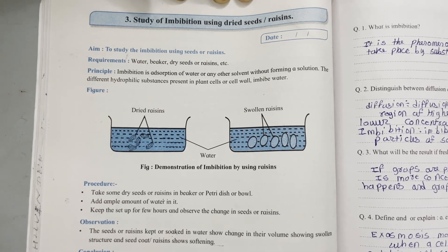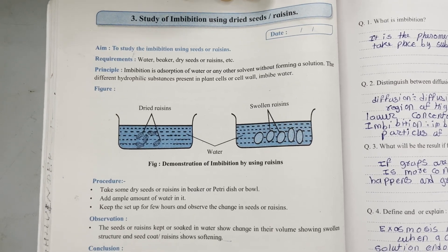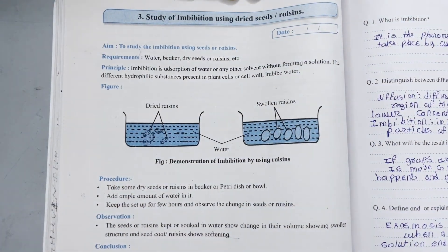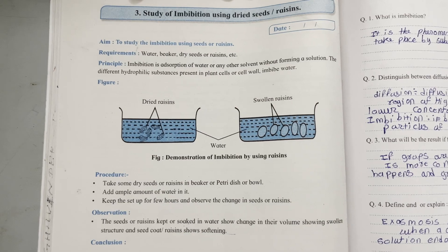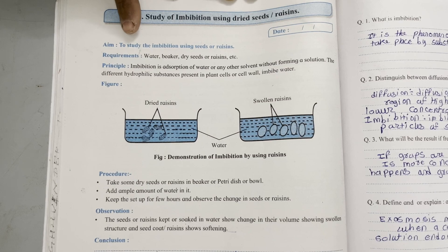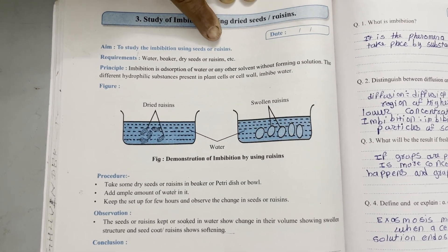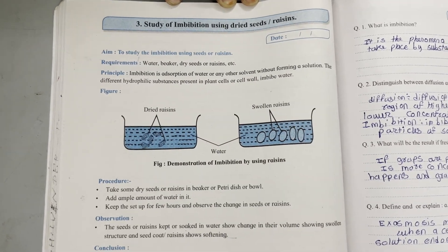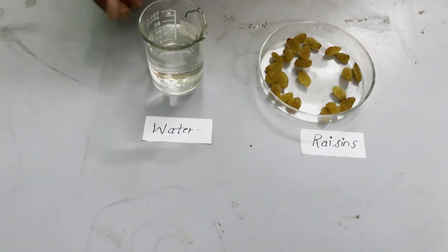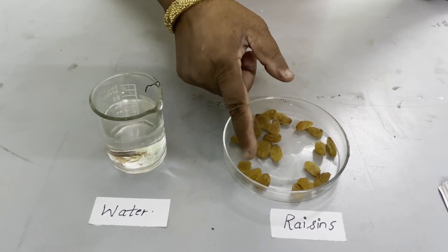Today we will be studying imbibition using dried seeds or raisins. I have brought raisins instead of seeds. This experiment comes under demonstration experiment number three. The aim of the experiment is to study imbibition using seeds or raisins. For this we will be requiring water and some raisins.